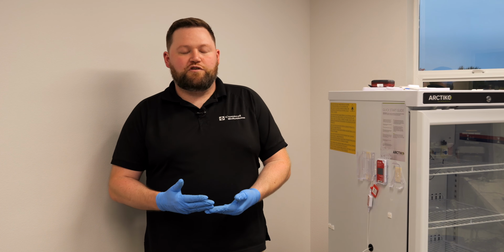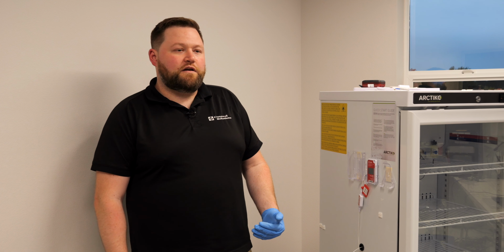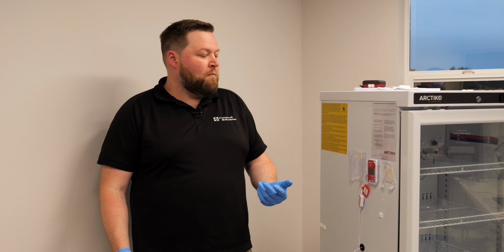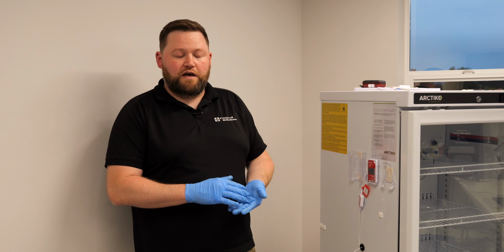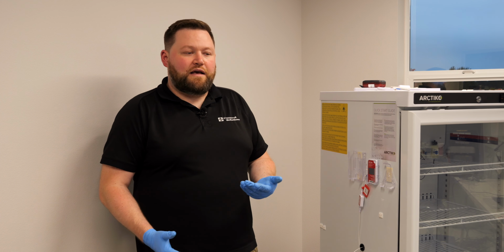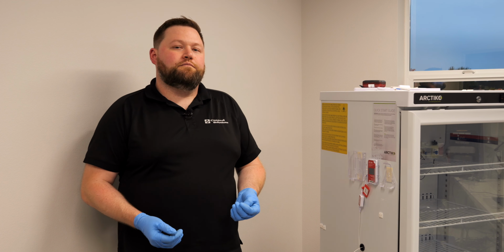Today we're going to go over the min and max temperature auditing on the VFC800 SP temperature data logger. The process is very simple and the device does log 2 sets of min and max temperatures. It has a user resettable min and max temperature that you can reset daily if you would like to during your temperature audits. It also has a min and max temperature that is auto reset every night at midnight.